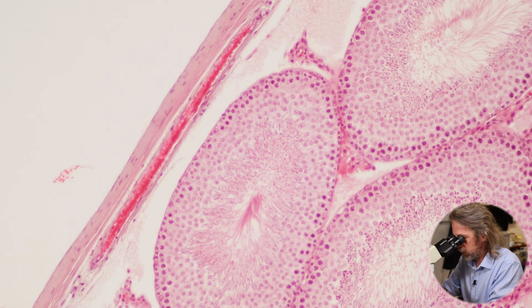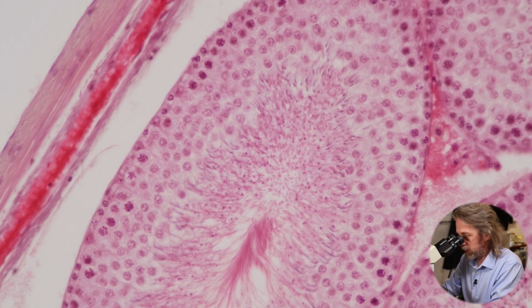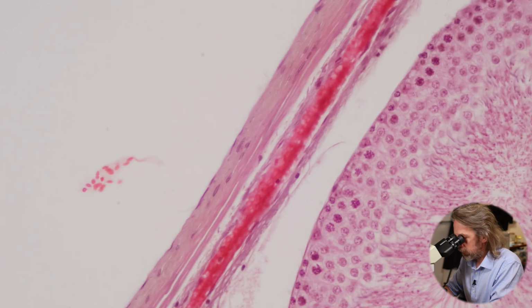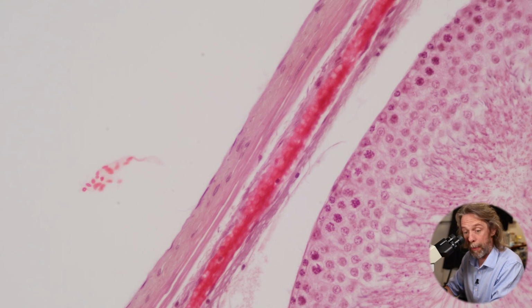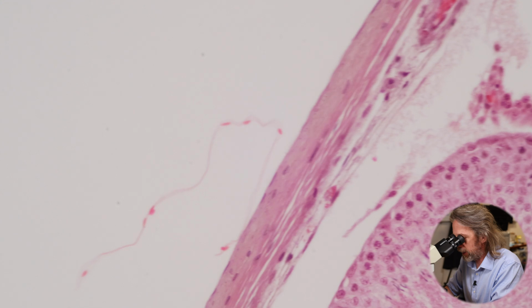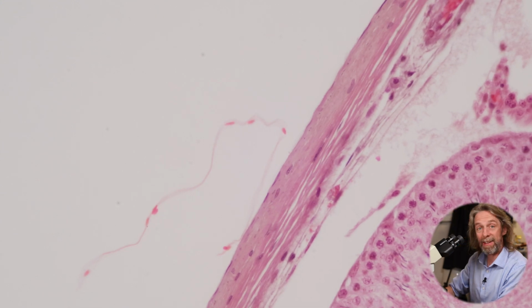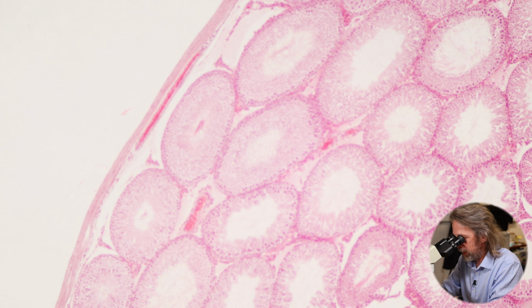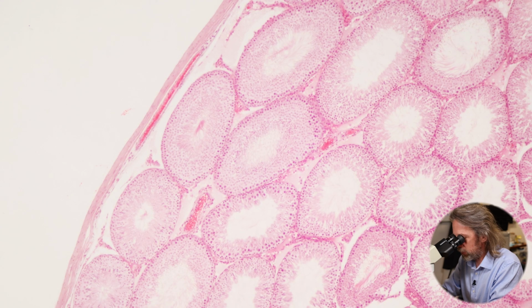Let's just zoom in a touch. And there we can see a blood vessel. Oh yeah, this looks like a very nicely stained section. So the solid layer is the tunica albuginea, and then we can see a blood vessel that happens to have been caught longitudinally. We can see the blood cells inside it. So that's the tunica vasculosa, the vascular layer deep to the tunica albuginea. Hey, this is great. I've gone off topic. I'm already talking in more detail than I originally intended to go into, but if I see it, it's very difficult to not say it.